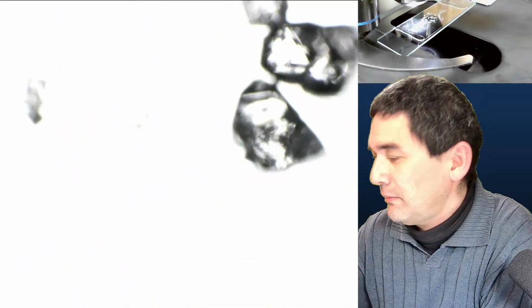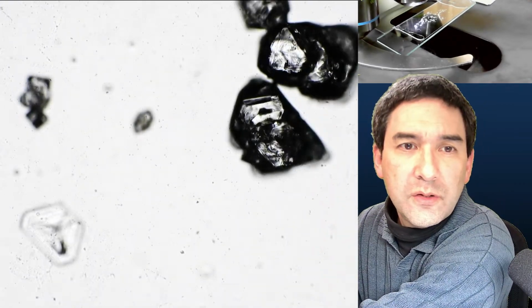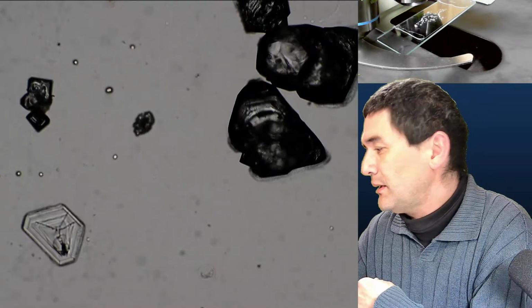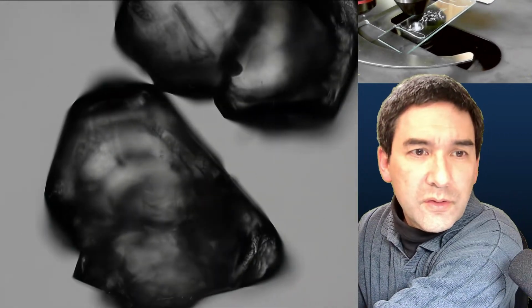Okay, so this is aluminum sulfate, and let's do it like this, and like this, and like this. So here we go.